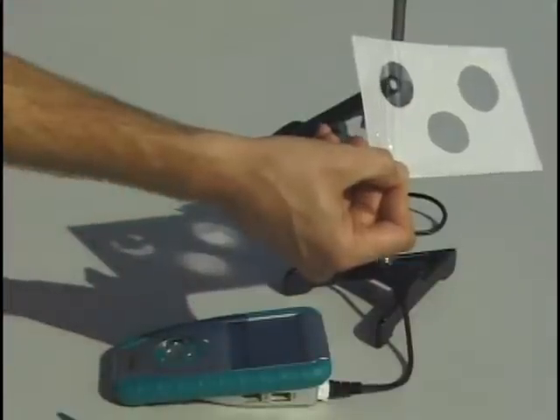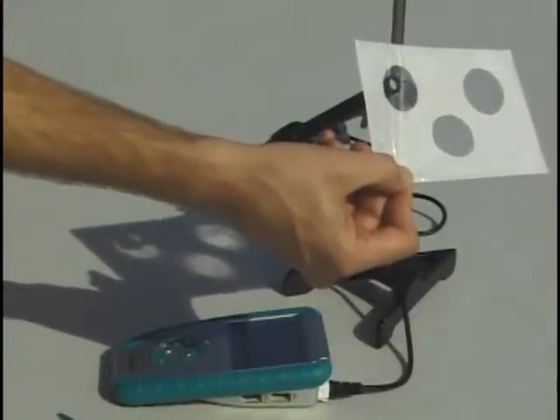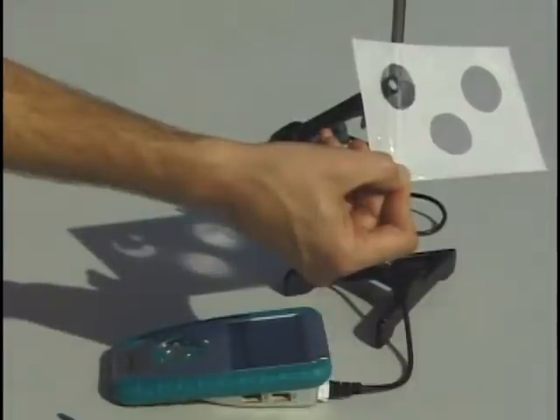We hit collect, and then we're going to collect data from each of the different samples for several seconds, starting with the control and then moving up in the UV protection factor of the different sunscreens.